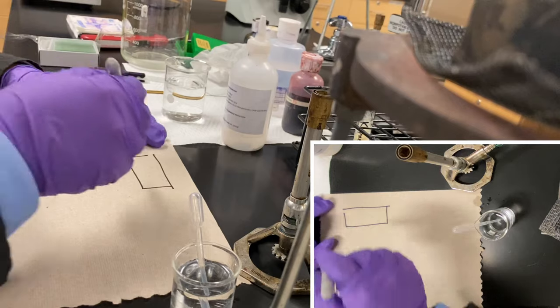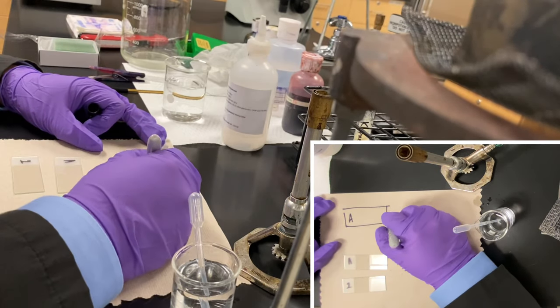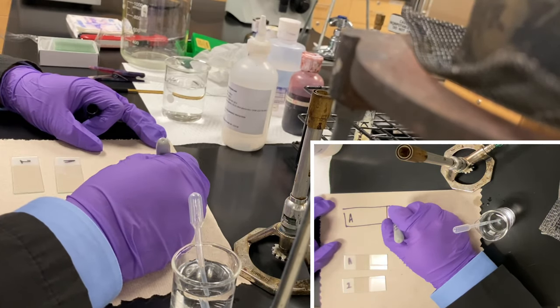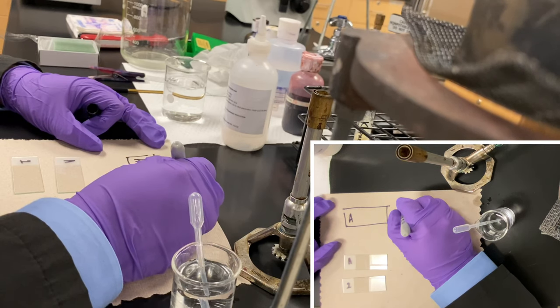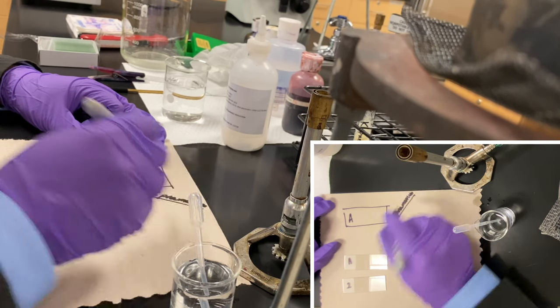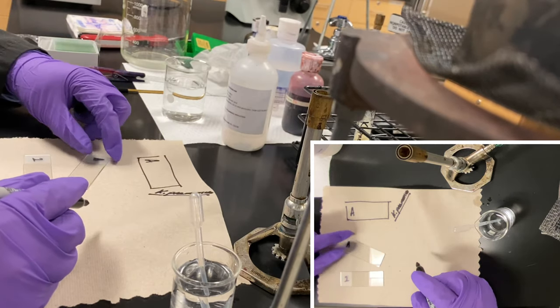Since I know this is going to be A, I'm going to write here that I'm going to use an organism called Klebsiella pneumoniae. So I know what's going there. I'm going to set up this slide.